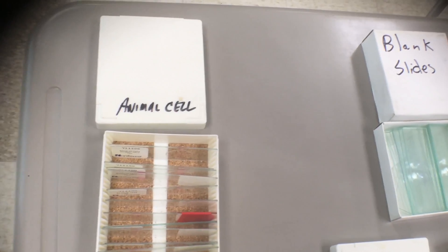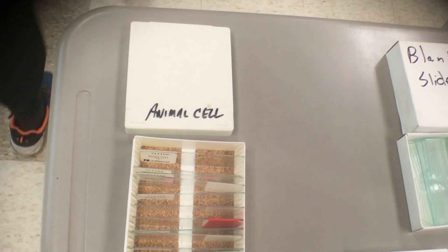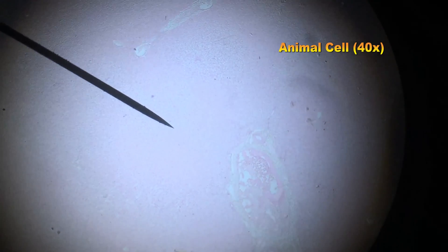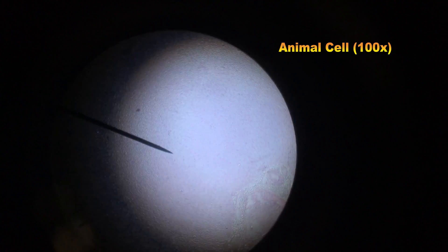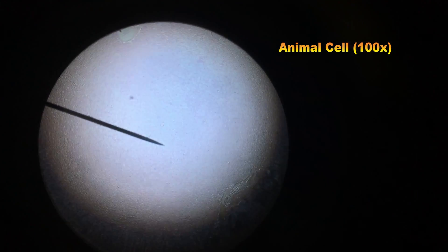Our next slide is the generalized animal cell. This is how it appears on the scanning power lens. Very few cells are actually visible because they are so small — all you can see is the general structure of the tissue. This is the animal cell on low power. Individual cells are difficult to make out, but they are becoming visible.